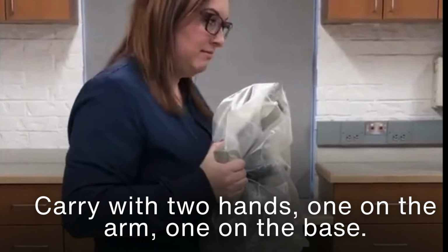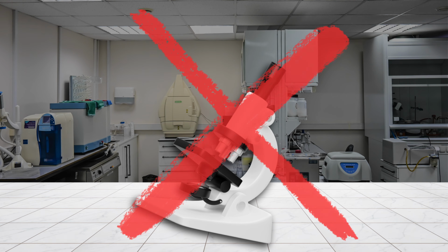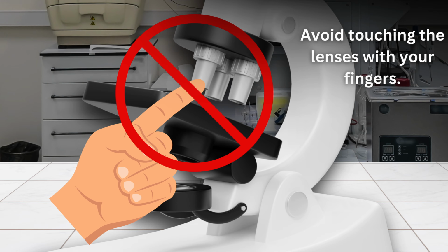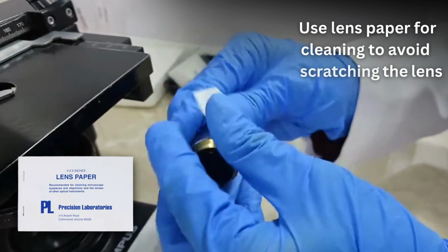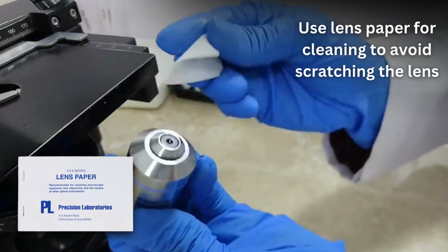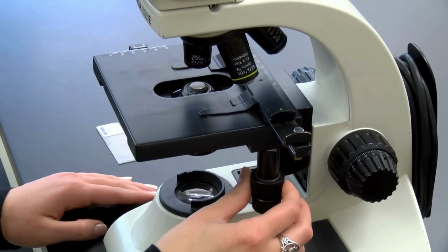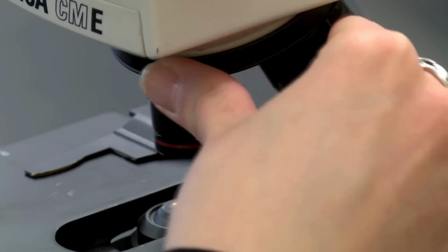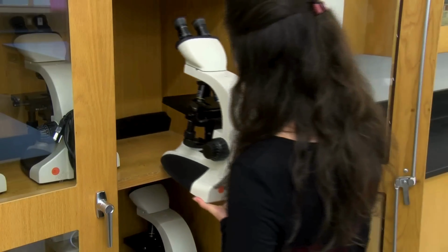First, never carry it with one hand. Never tilt it. And avoid touching the lenses with your fingers. When cleaning the lens, use lens paper to avoid scratching the lens. And when storing, always lower the stage, switch to the lowest objective, and place it gently in its cabinet.